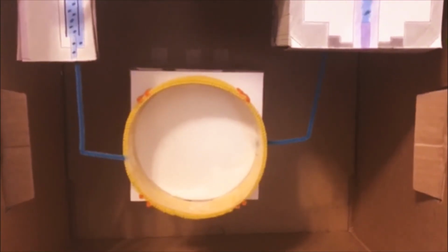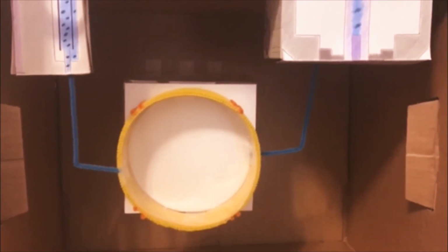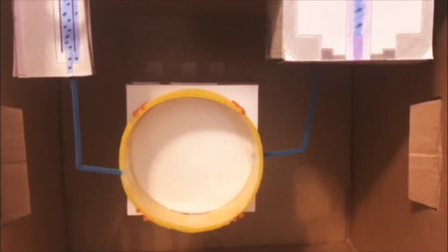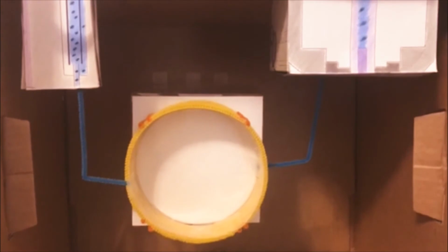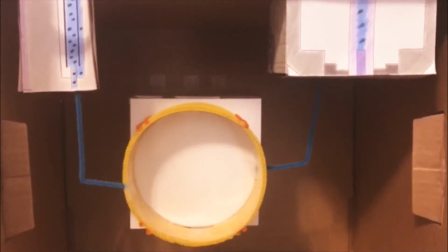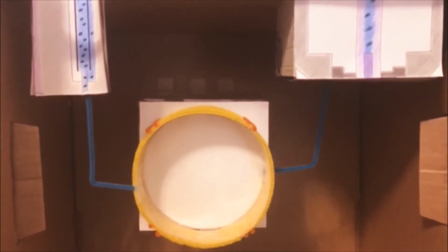Say we have a sample that consists of methanol, ethanol, and butanol. Since the stationary phase in this particular gas chromatography is polar, and all of the compounds in the sample are also polar because they're all alcohols, the elution order will be based on their boiling point. Thus, the elution order would be methanol, ethanol, and finally butanol.